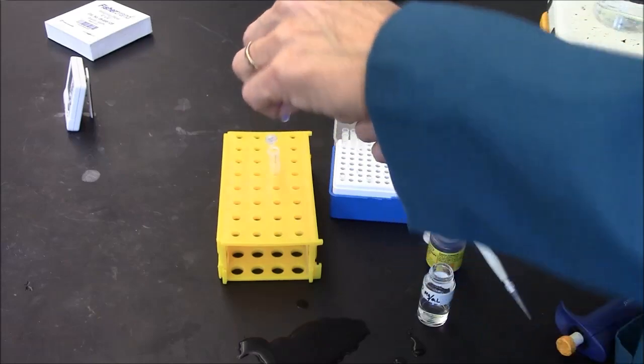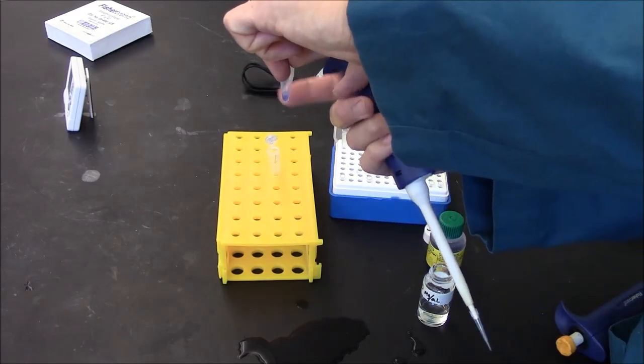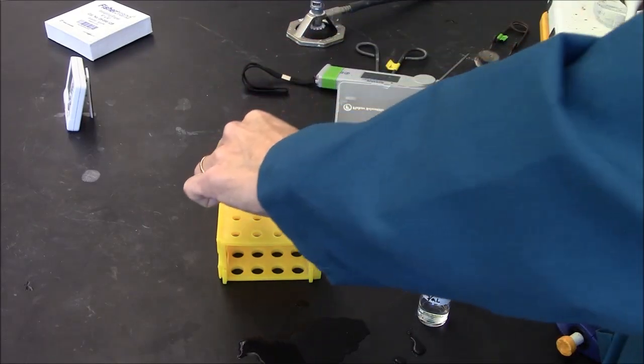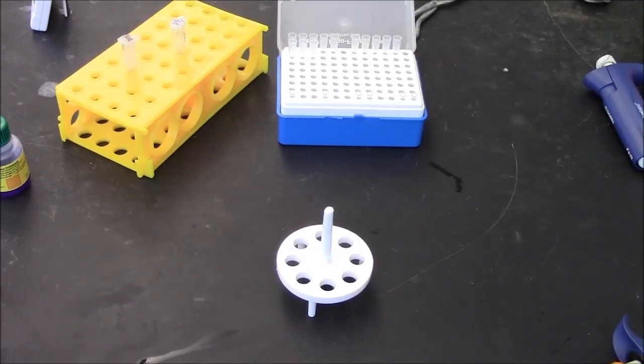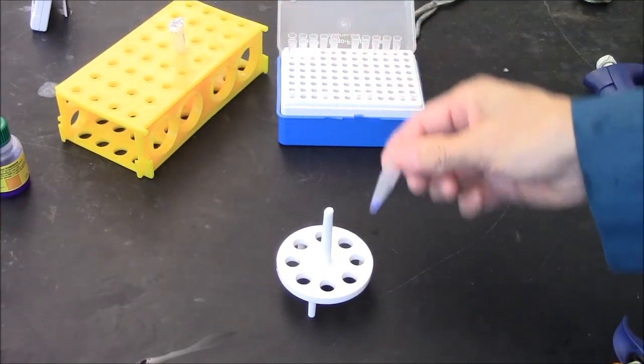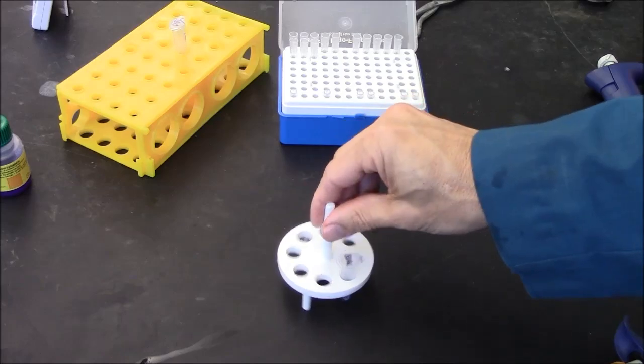Once again I'll gently agitate so it's all mixed together. Now I'll put my protein solution into this flotation device.